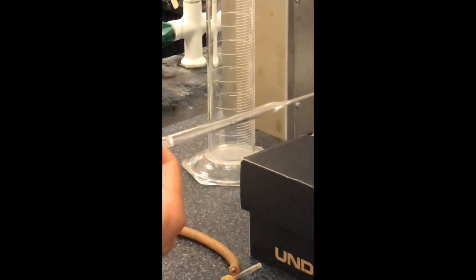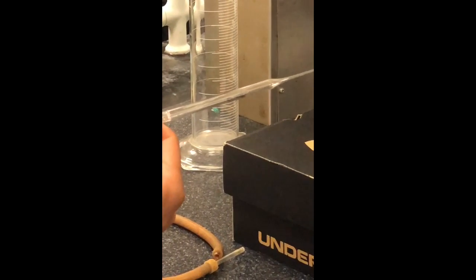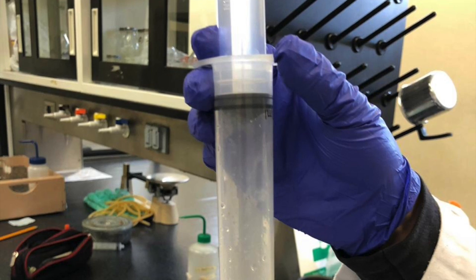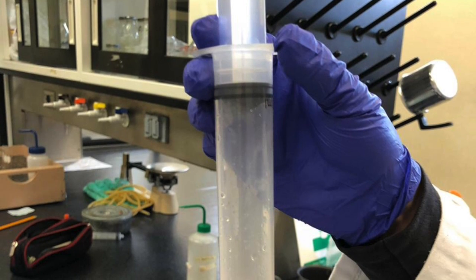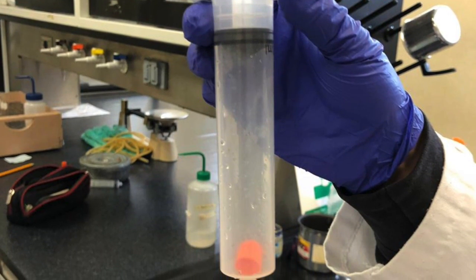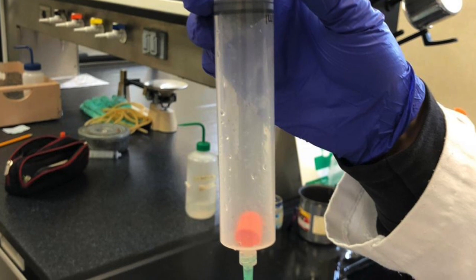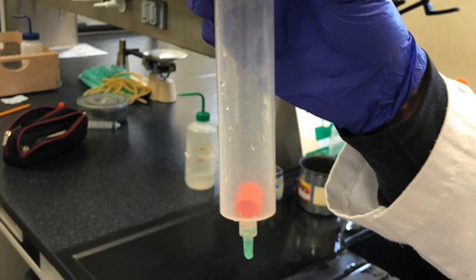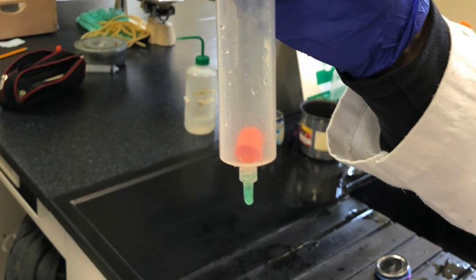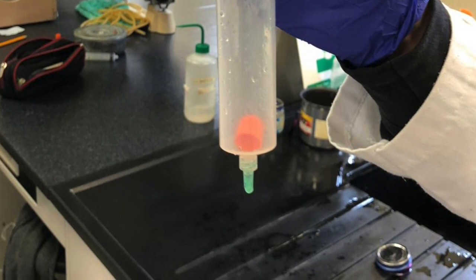To make oxygen, we needed 5 milliliters of 6% by volume hydrogen peroxide and 0.1 gram of solid potassium iodide as catalyst. To make the experiment, we had to light a wooden stick with the matches and then turn it off. They must be splinters. Immediately and very quickly, we dispensed 5 milliliters of oxygen from the syringe directly onto the stick. We observed that the flame became a more intense red.